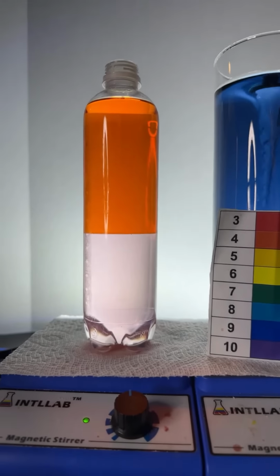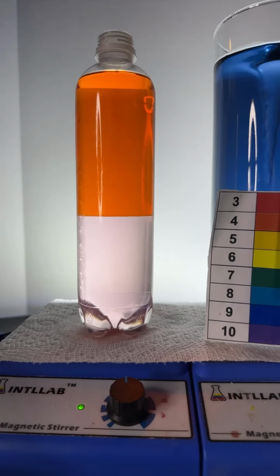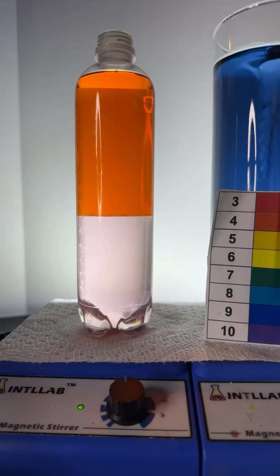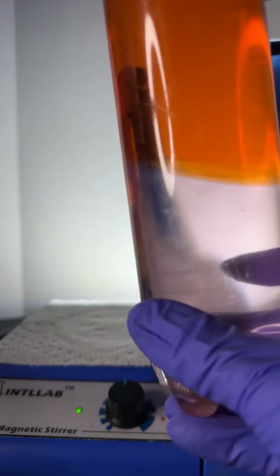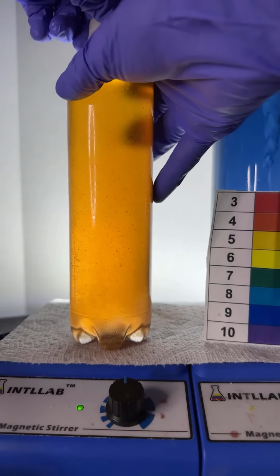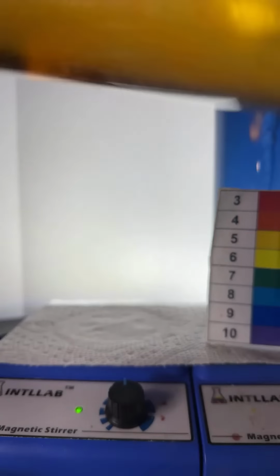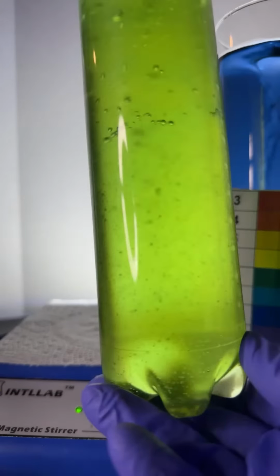Back at it. Let's add some sodium hydroxide solution. We're going to try to get this to pH 7. Let's add like 2 drops. See what happens. All right. 2 drops sodium hydroxide solution. Give this a shake. That doesn't look like much happened. Oh, yeah, I see a shift to yellow. I see a slight shift. Oh, my goodness, it went all the way to green. That's kind of cool. It just took a little bit.